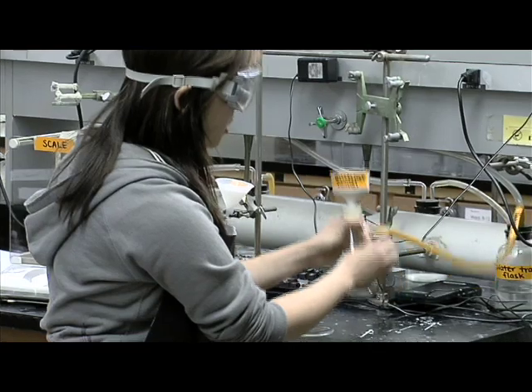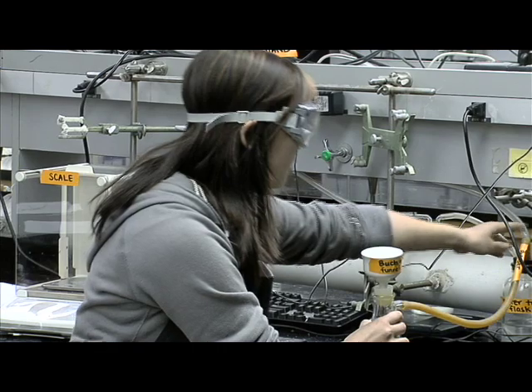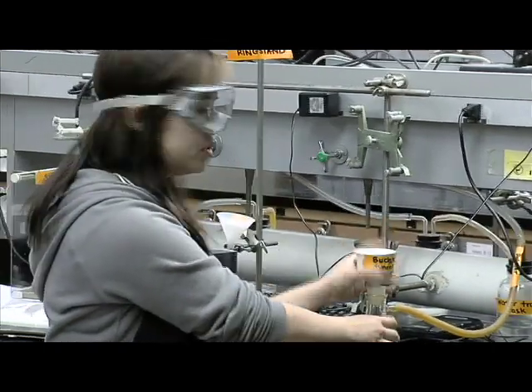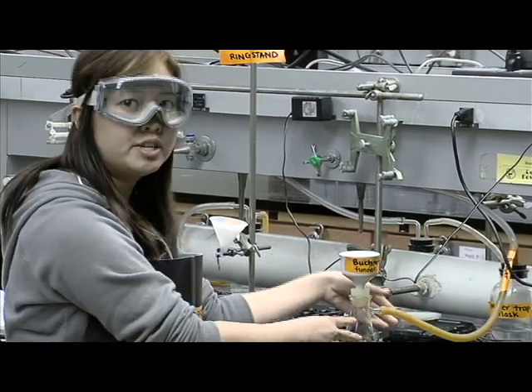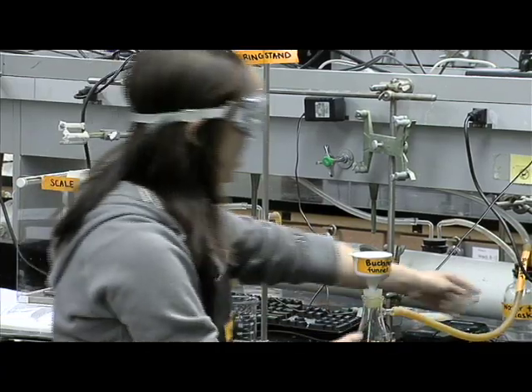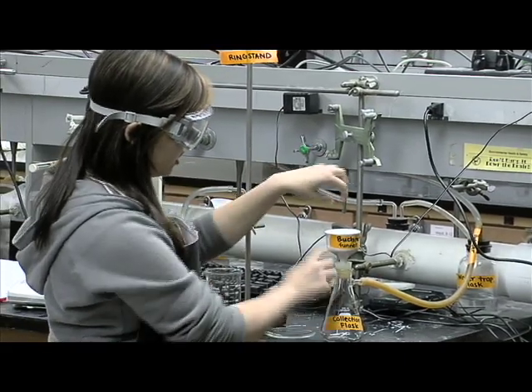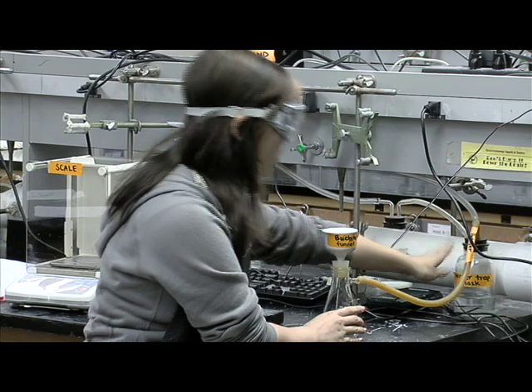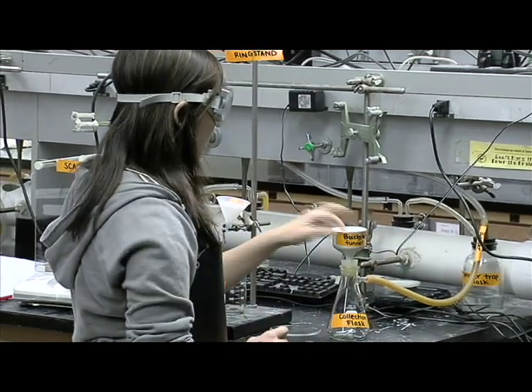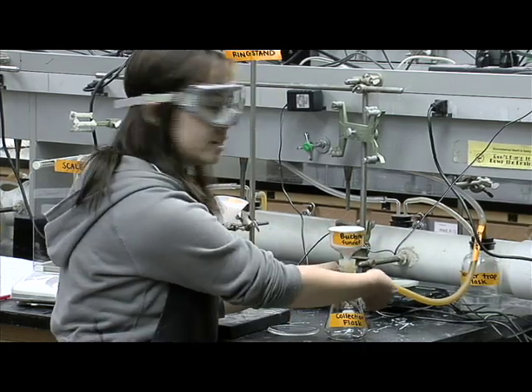The Büchner funnel has a rubber stopper at the bottom. You place that into the collection flask and make sure it fits firmly so that the vacuum will work correctly. Connect the rubber tubing from the side arm of the collection flask to the water trap flask. Use very thick rubber tubing to prevent pinching from atmospheric pressure. The water trap prevents water from the filtrate from going up into the vacuum — instead, it goes into the water trap.